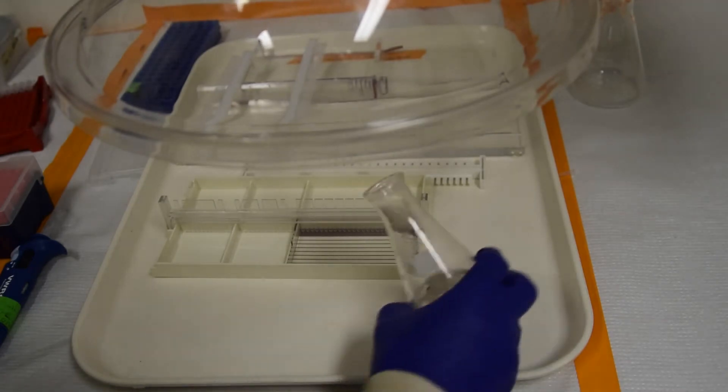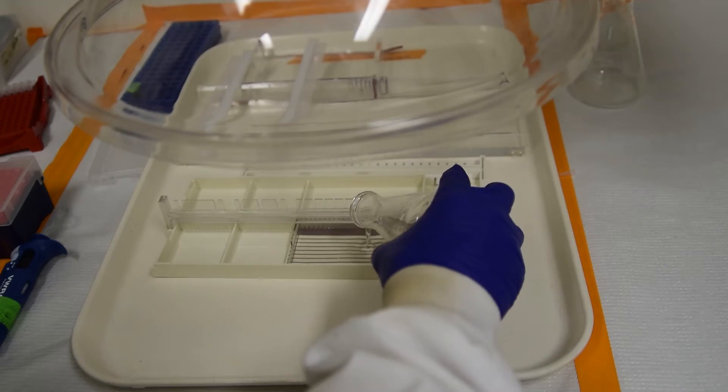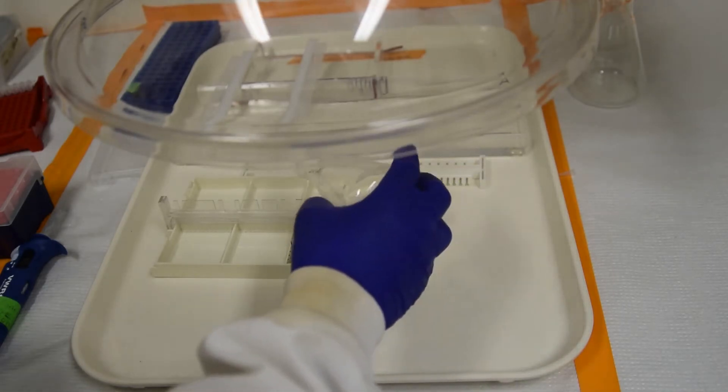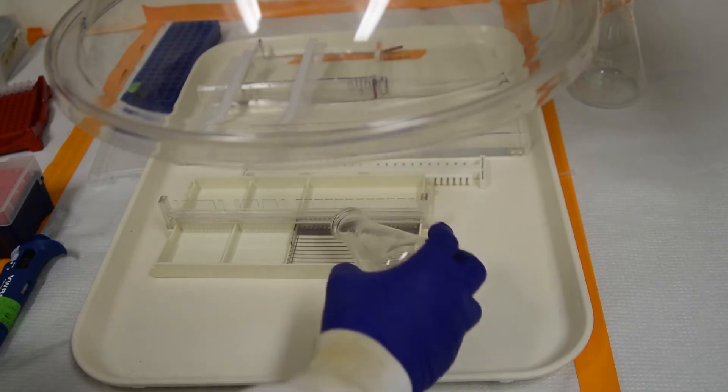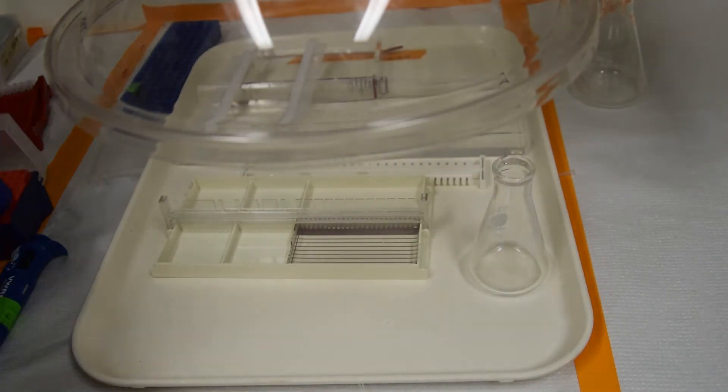While the gel is still warm, pour into the tray. Remove any bubbles with a pipette tip.